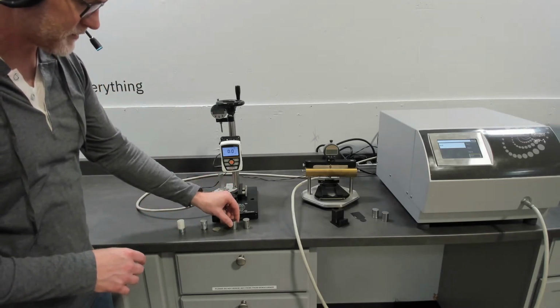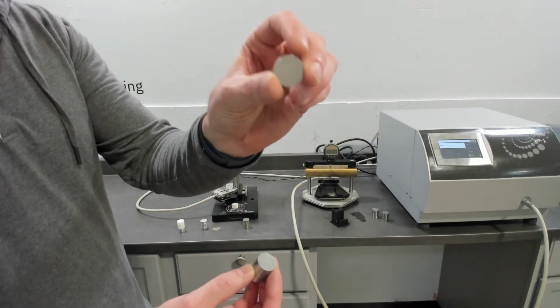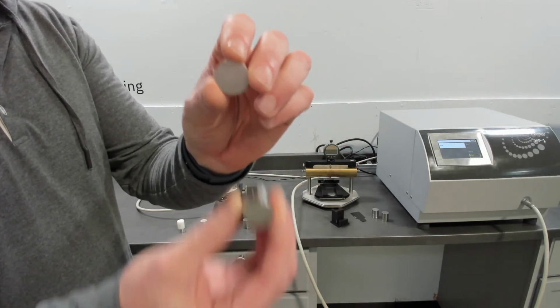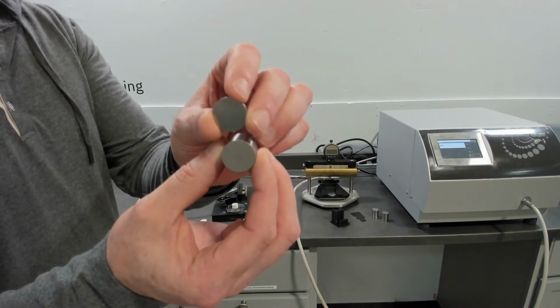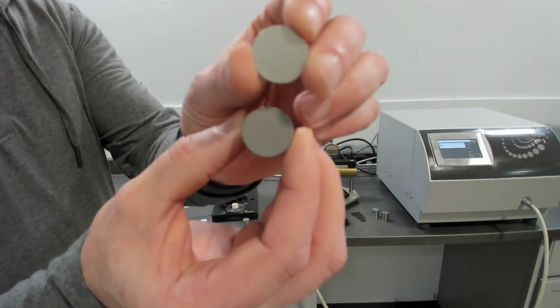Today we're going to do a measurement on stainless steel, piece A. This is your primary piece. It's a 3 millimeter piece of stainless steel. We've standardized the diameter to 21 millimeters. Of course, we can vary that diameter based off the application, but this is our standardized dimension.